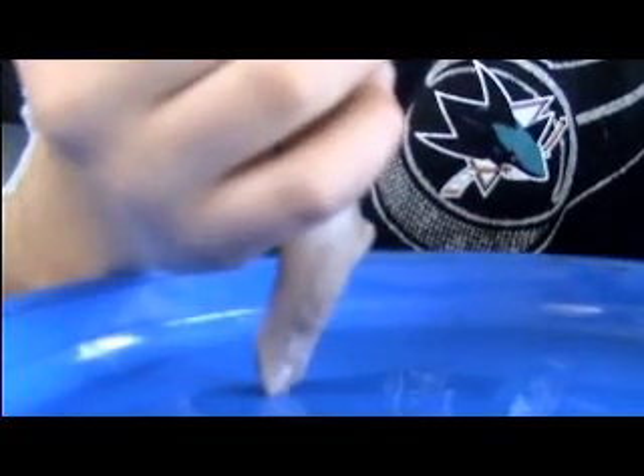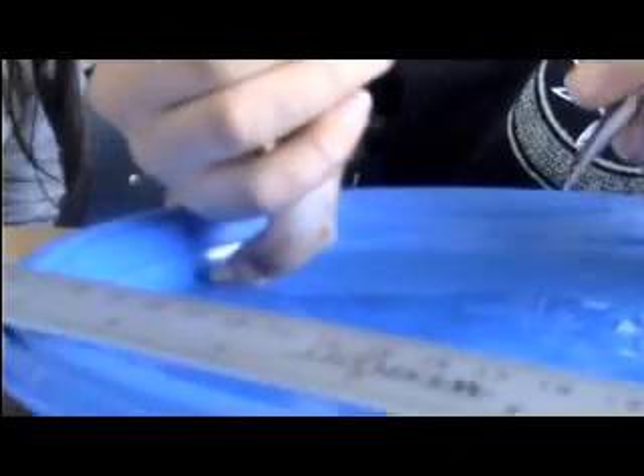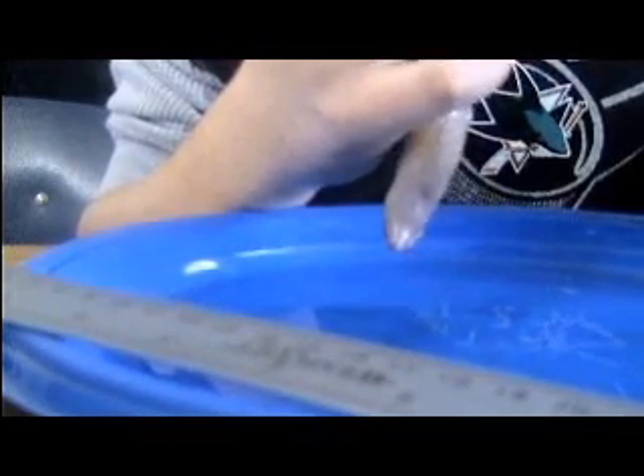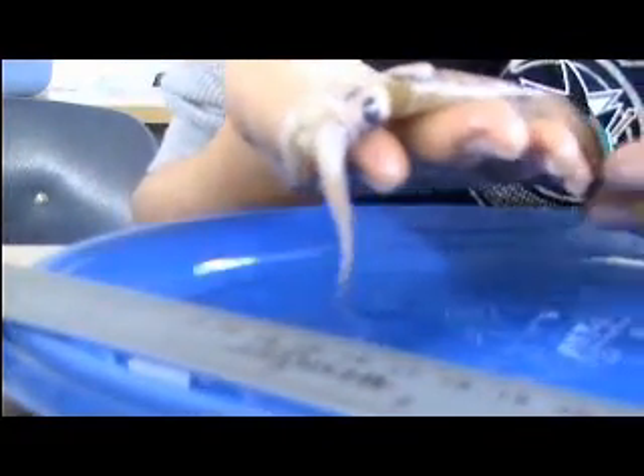What's the name? You should scoot it back a little — yeah, it's a lot better. I put a Sharpie on there. Where's that located? A black speck at the base of the arms. On the beak. I got the beak. Look at the mantles and tan ones — the colors you see.